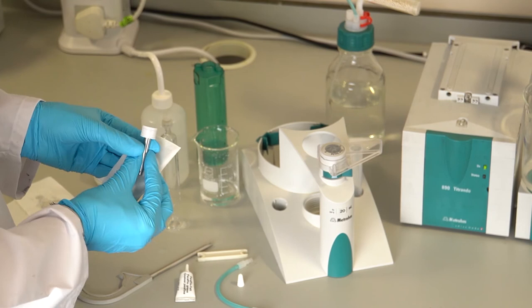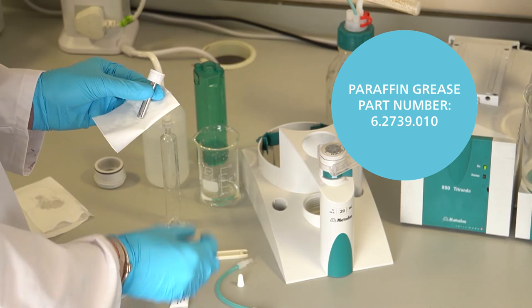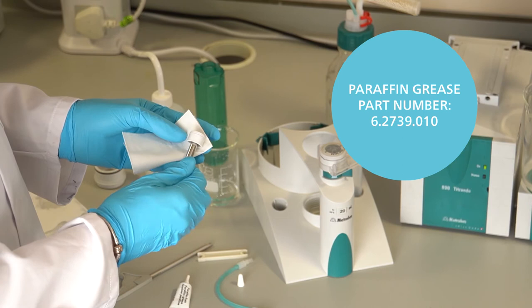Re-grease with paraffin grease. Take care to only grease the sides of the piston, ensuring no grease is applied to the head of the piston. Any excess grease should be wiped off.